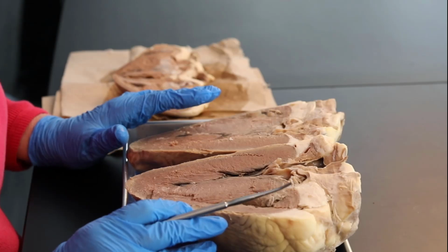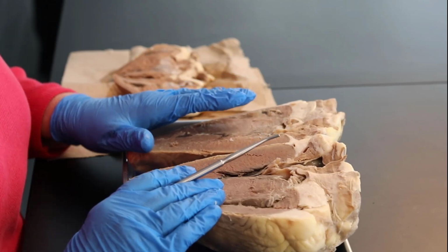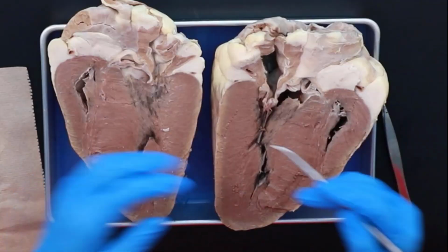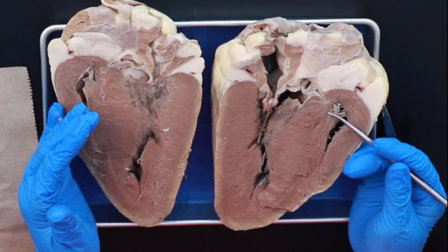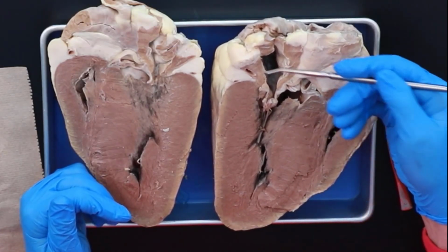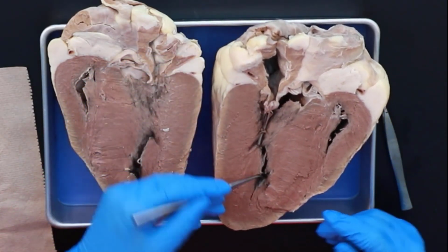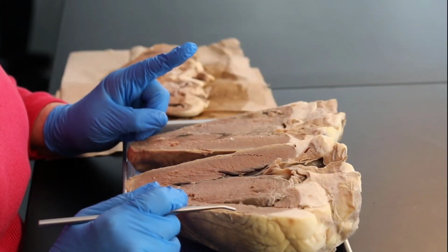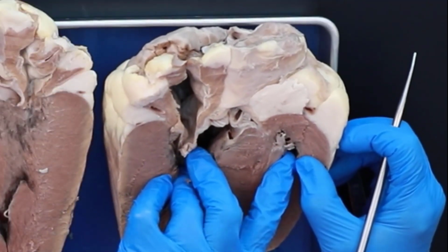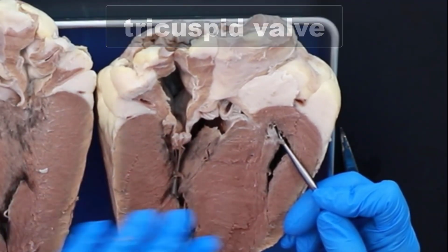Now, once you know the side of the heart, then that tells you the names of the valves. So what you learn is you've got two different kinds of valves. You've got what are called atrioventricular valves and your semilunar valves. Your atrioventricular valves run between the atrium of the heart and the ventricle of the heart. Okay, from here to here. And you have two, right? Because you've got two sides of the heart. For the right side of the heart, which is here, this is the tricuspid valve. It has three attachments. We'll see it better on the sheep's heart.